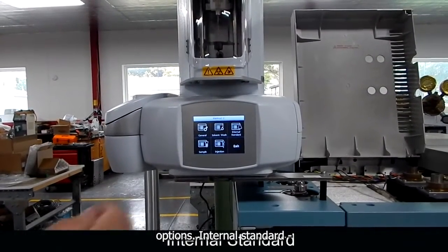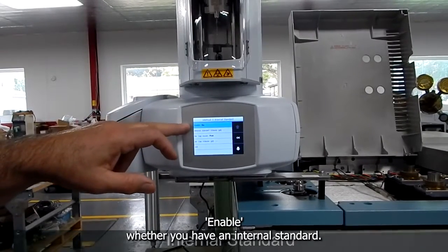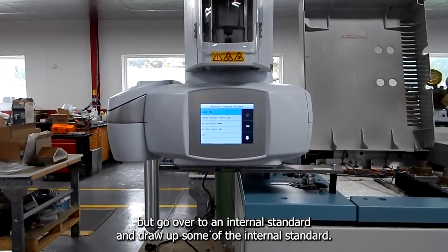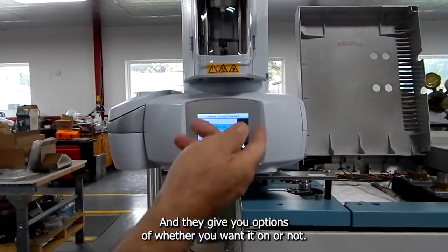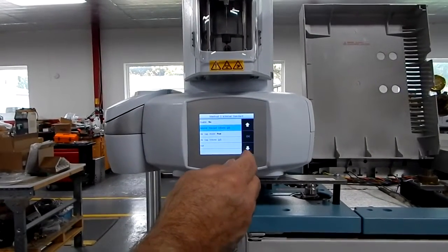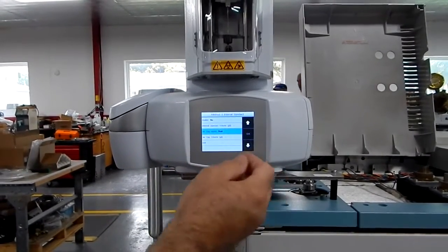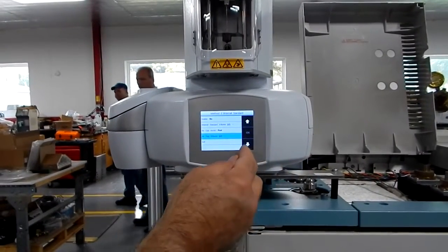options. Internal standard, enable whether you have an internal standard. This has the ability not only to pick up your sample, but go over to an internal standard and draw up some of the internal standard. And they give you options of whether you want it on or not, and how much internal standard you want to draw up. Gap mode, whether it's when you want some air in there, and how much air do you want in there.